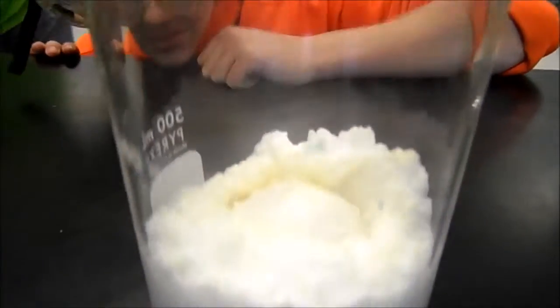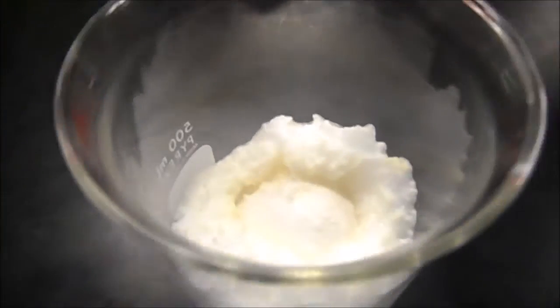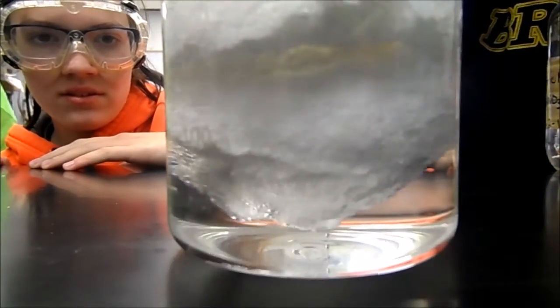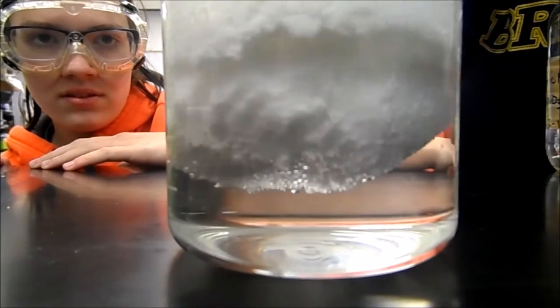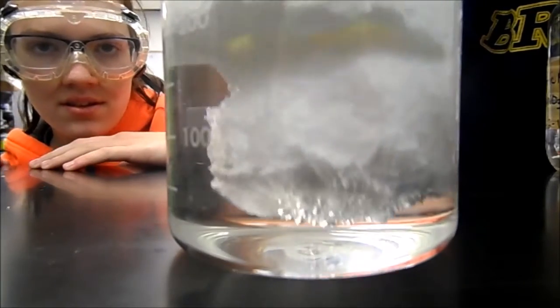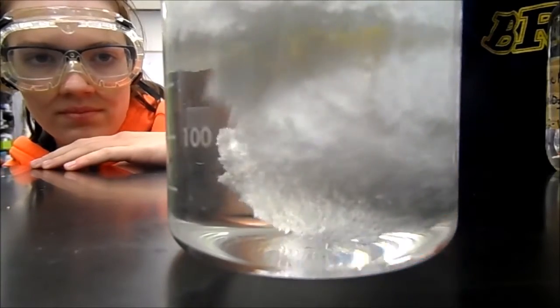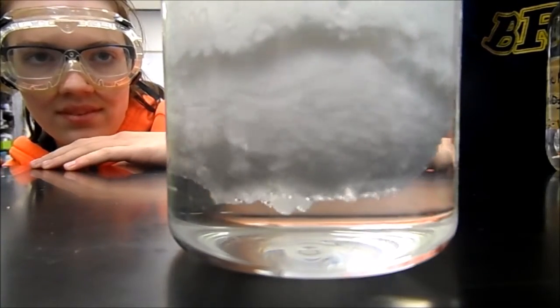Where's the yolk? Just put it back and let it set up. Oh I see the yellow, is that the yellow? What is it, the yolk? It's gonna stain like a sack. You can see it kind of. It's still a solid. Well the egg is still solid, the egg is in like a sack.